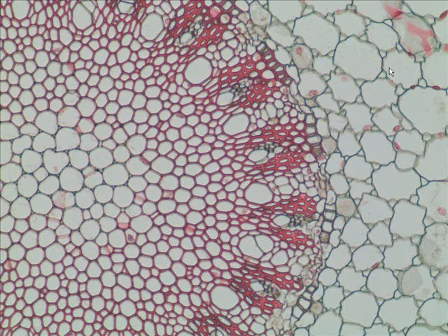There we have it. Here we have the what tissue right here? Parenchyma. Yes. What region of the root is this? Out here, it is cortex. Yes. What tissue is this in here? Parenchyma again. Right. What region of the root is this? It is the pith. Okay.